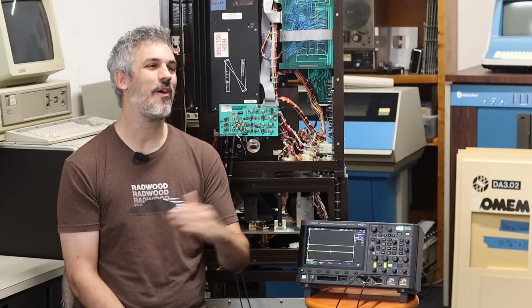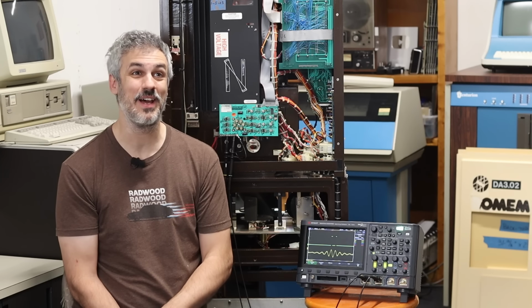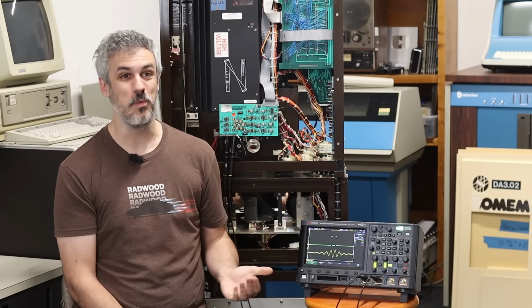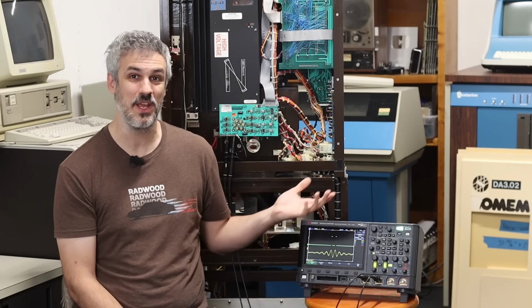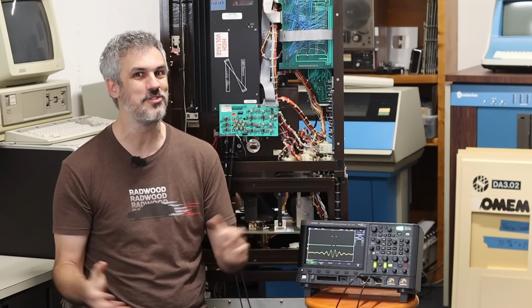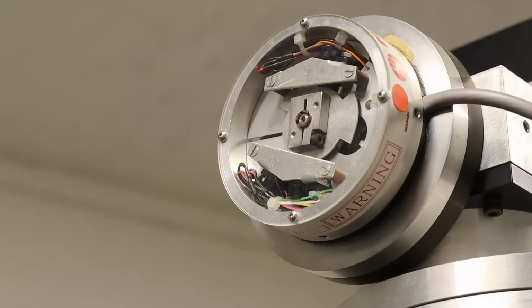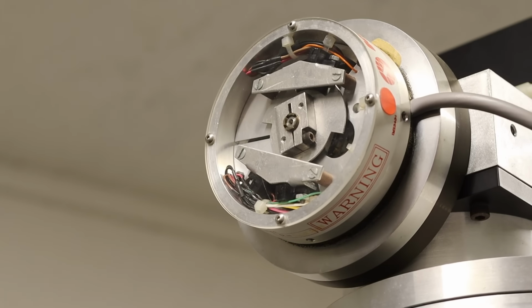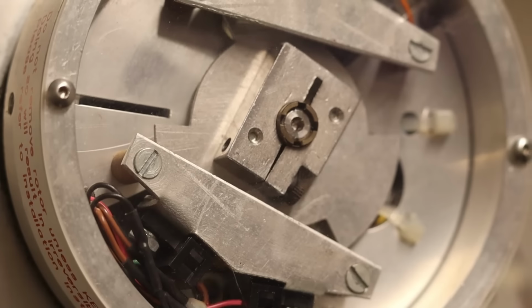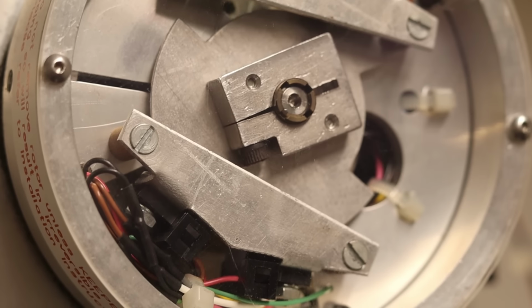I spent hours on the phone with Mike yesterday, hours on the phone with Mike today, and the answer is that we don't know yet. This is very weird. Mike has never seen any other spectrometer do this exact problem, so we're in kind of uncharted territory here. We have two working theories at the moment. The first is that the motor up here could be just enough out of spec that it's causing minor vibrations to get transmitted to the mirror, and we're seeing those minor vibrations get picked up by the sensor down here.